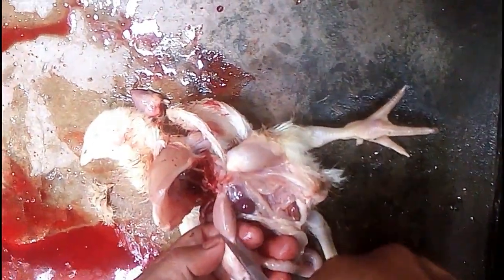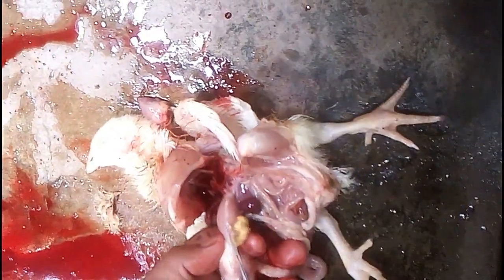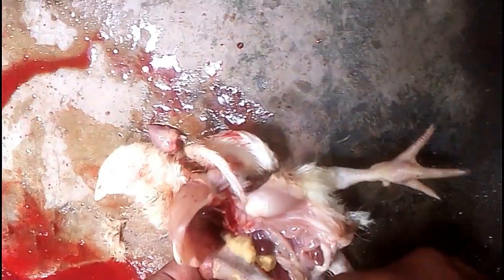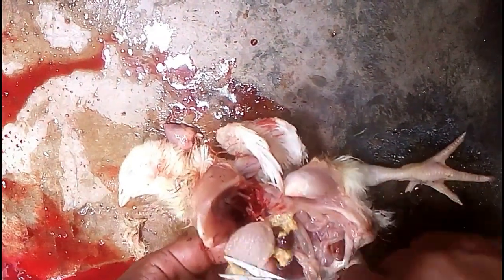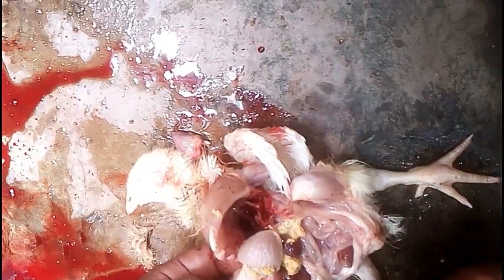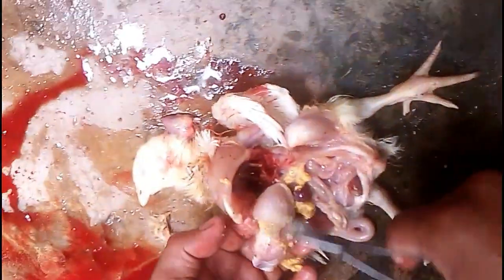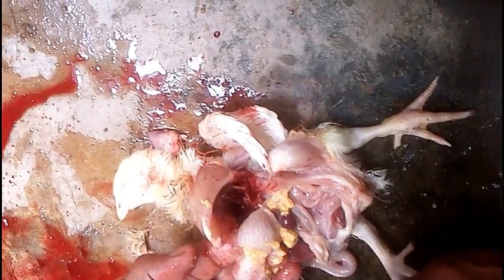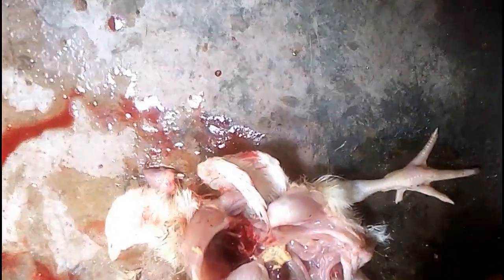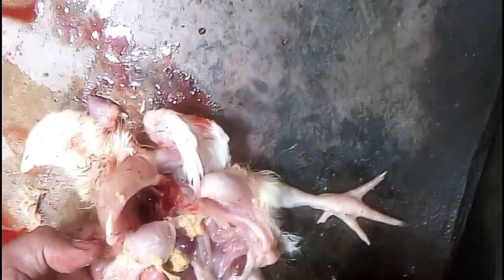This is the proventriculus. We open the proventriculus to find out any abnormalities, but we see that it is fresh. The lining of the proventriculus and the junction of the proventriculus also appear fresh and normal.